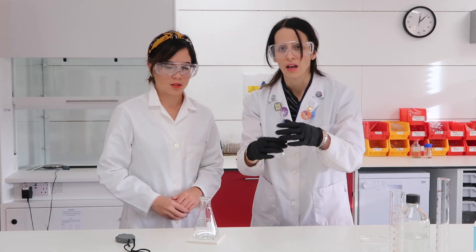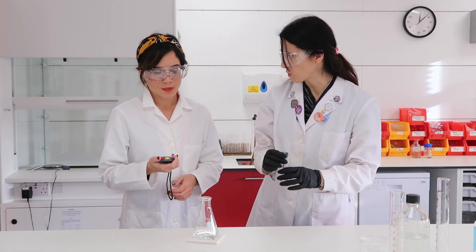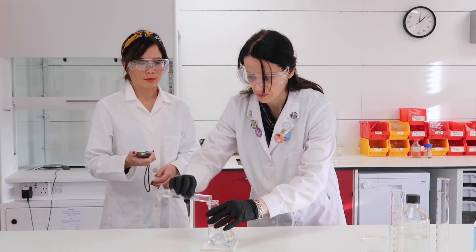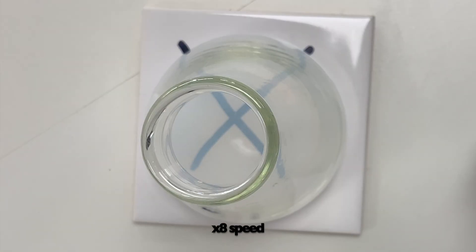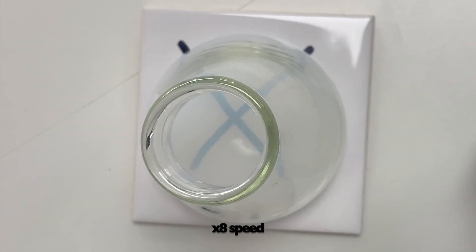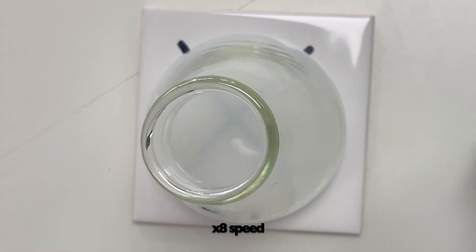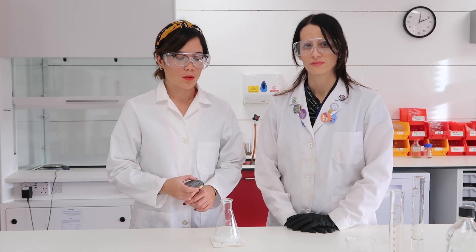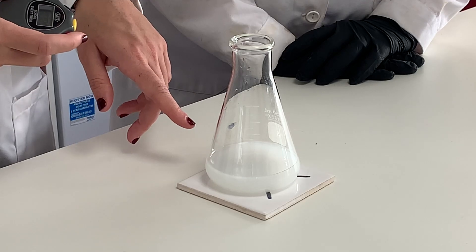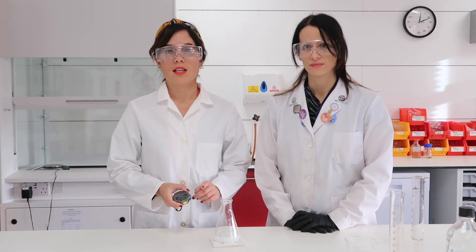Emilia swirled the flask to mix the contents, and now we're going to add the hydrochloric acid — as soon as it's added, we start the stopwatch. She swirled the contents of the flask and now we simply wait. According to my timer, it took three minutes and three seconds to obscure the cross. If you consider how clear the cross was to begin with, that sulfur precipitate has really hidden it well.